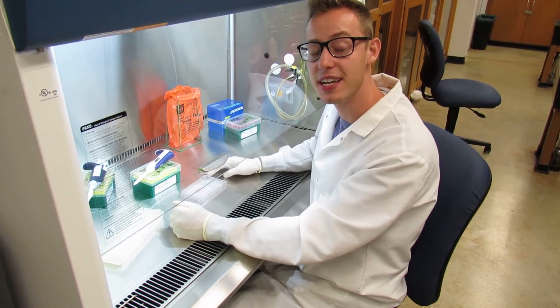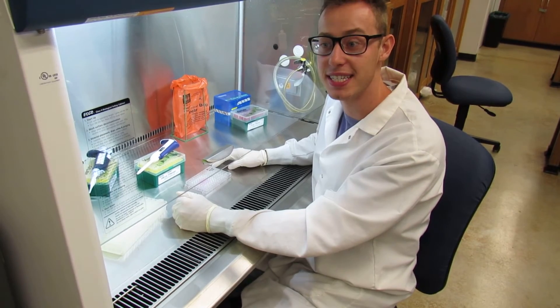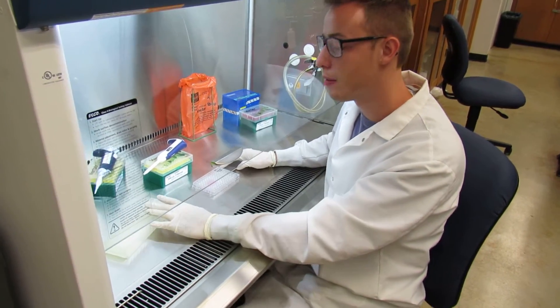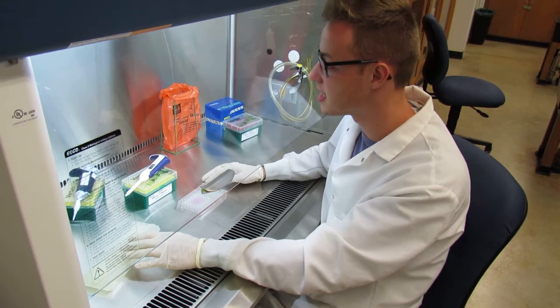Alright, now that you've successfully set your plate reader, you are ready to add the XTT activated dye to your sample. Remember, this dye is made right before you're getting ready to use it as it is time-sensitive.